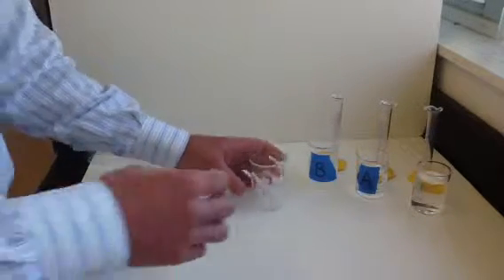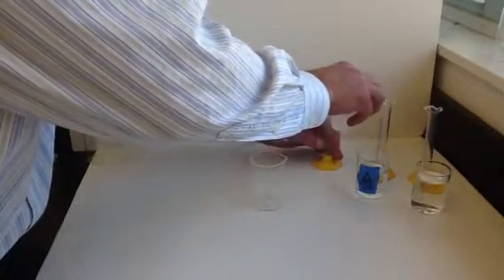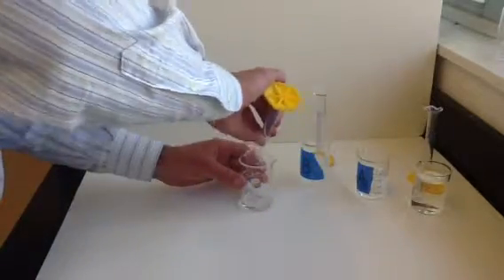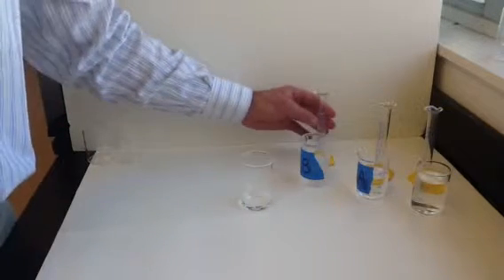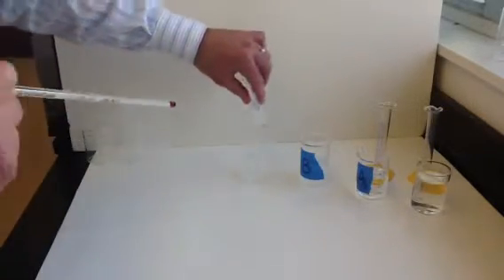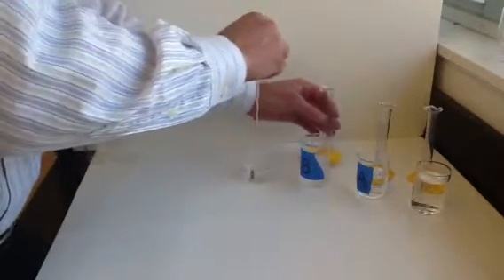In our first trial, we're going to measure out 10 milliliters of B and 10 milliliters of A. And we'll put A into this beaker, and then we'll add B to it. When I add chemical B to it, you should start your stopwatches because we're going to time how long it takes this reaction to go to completion. So we'll start our timers right now, and I'll stir that a little bit, and then we'll let it react.